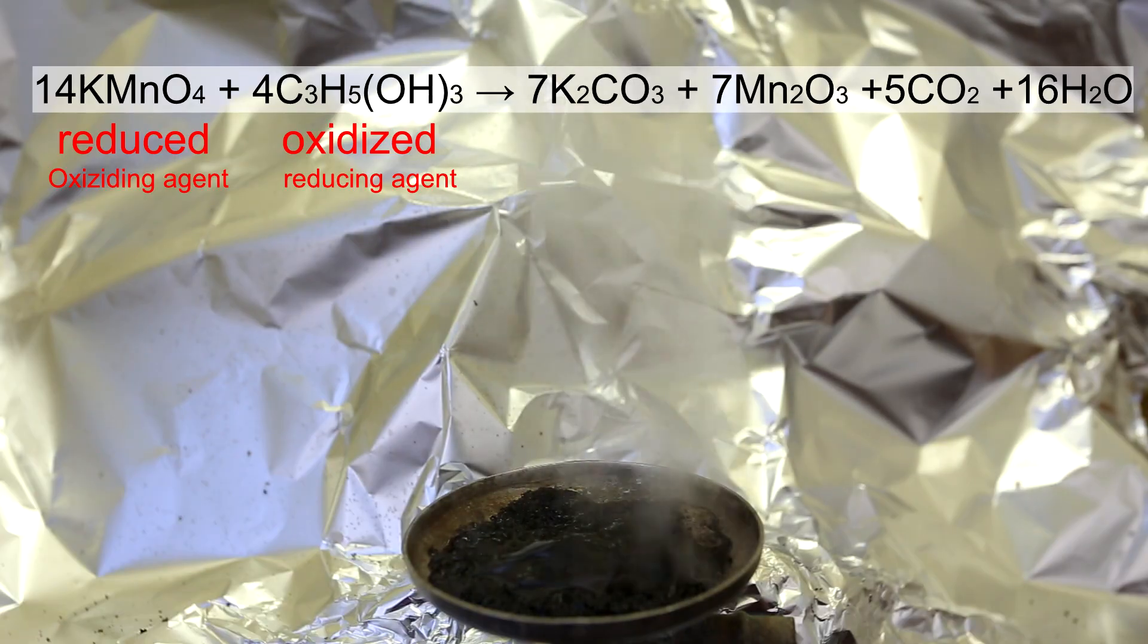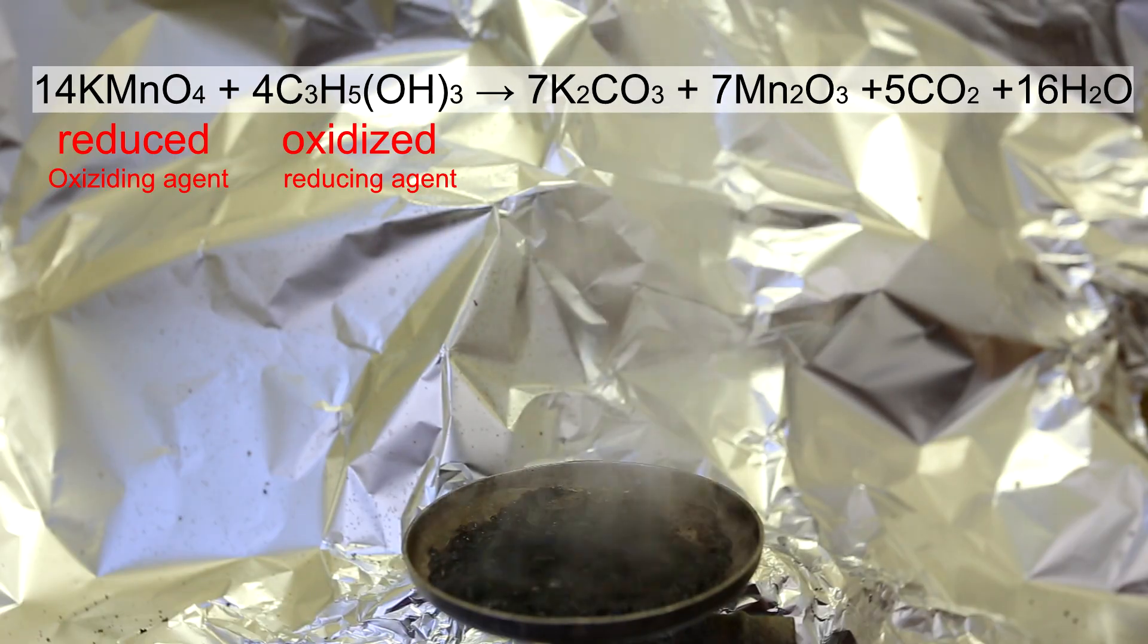In our case, the potassium permanganate is receiving the electrons and the glycerin is donating them.